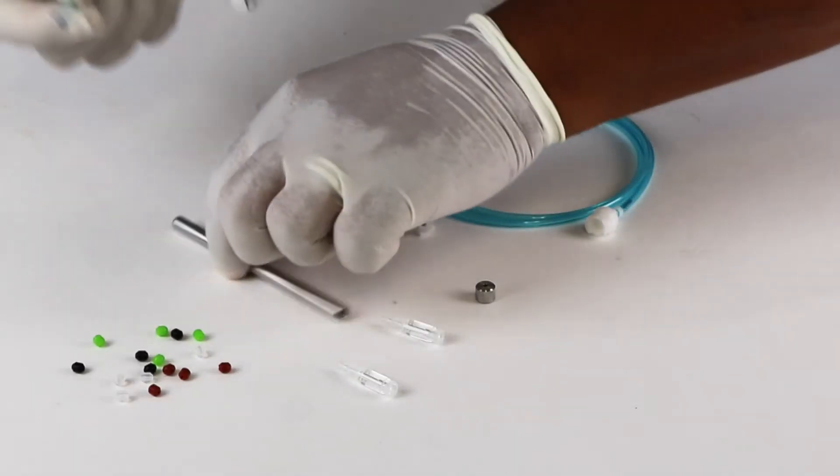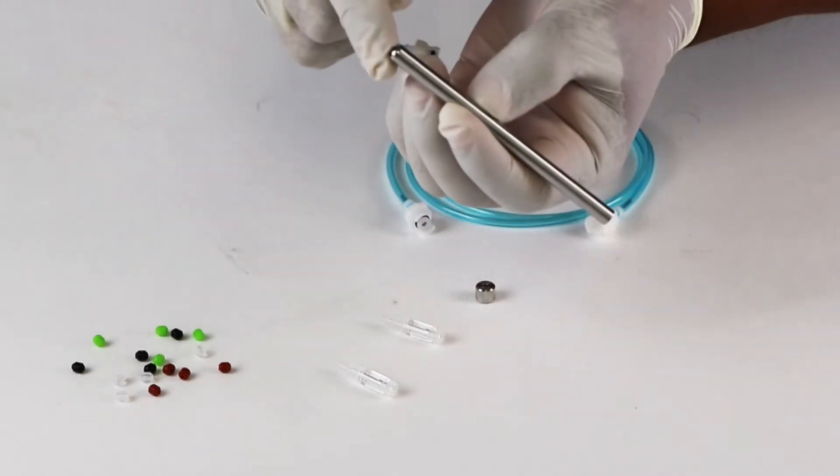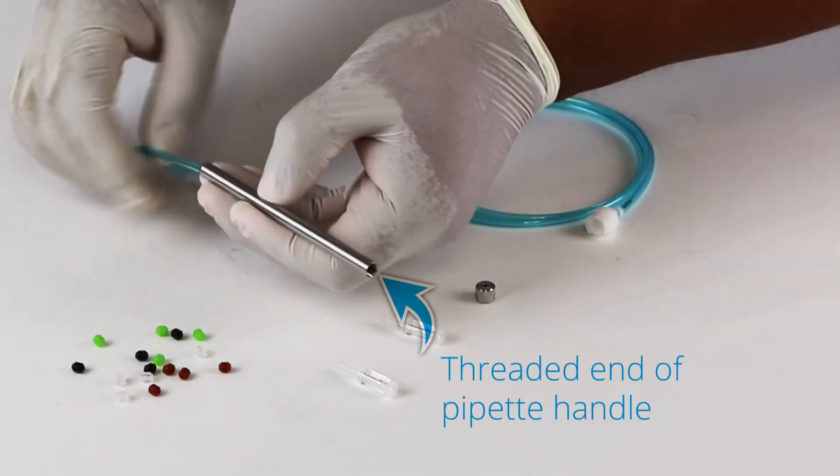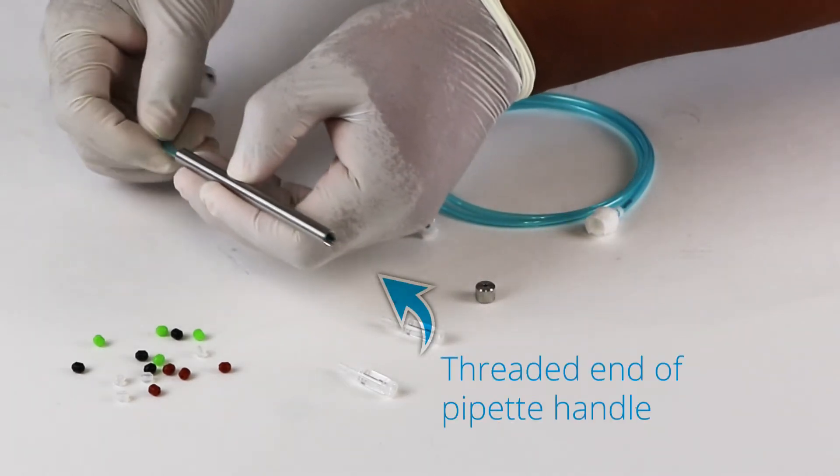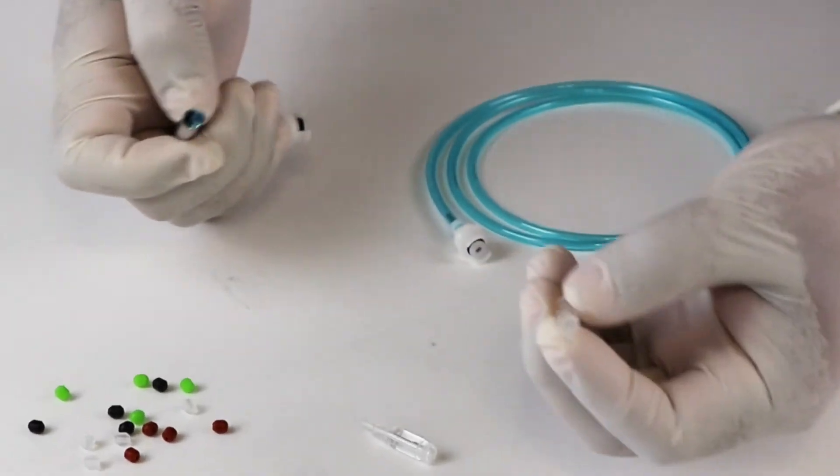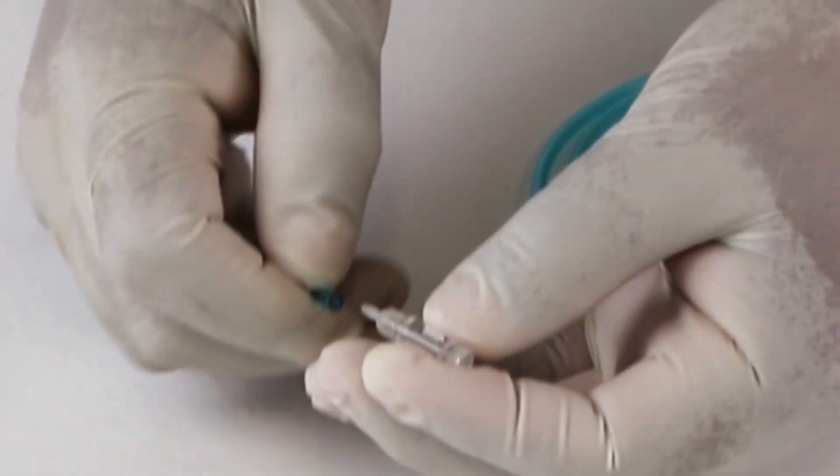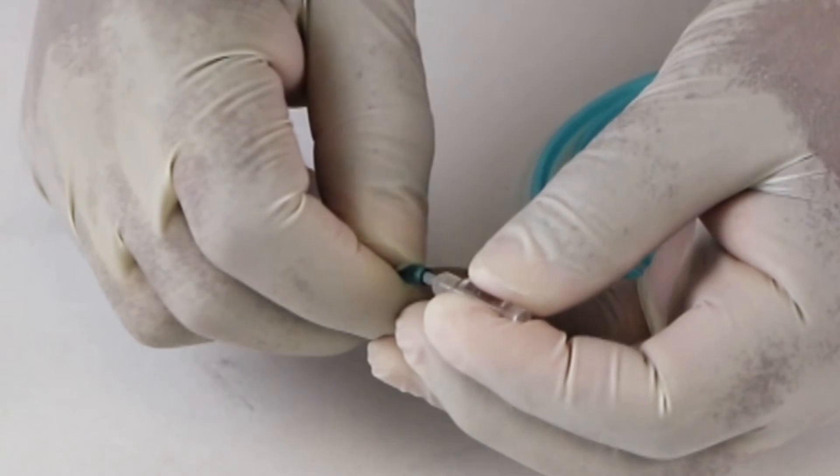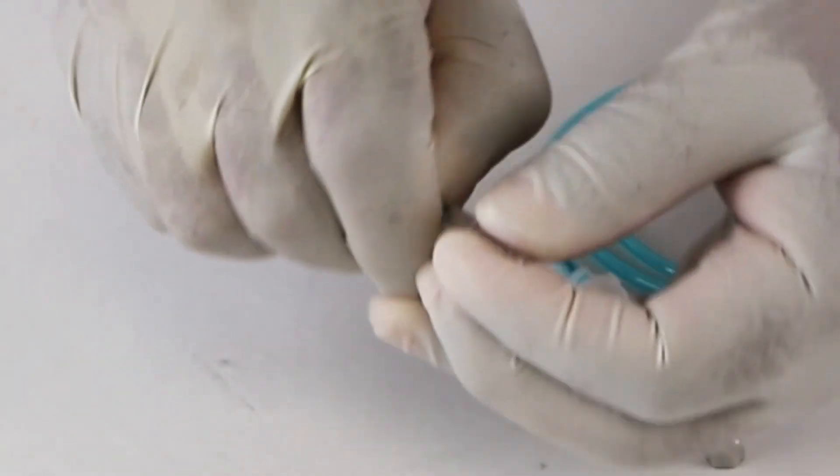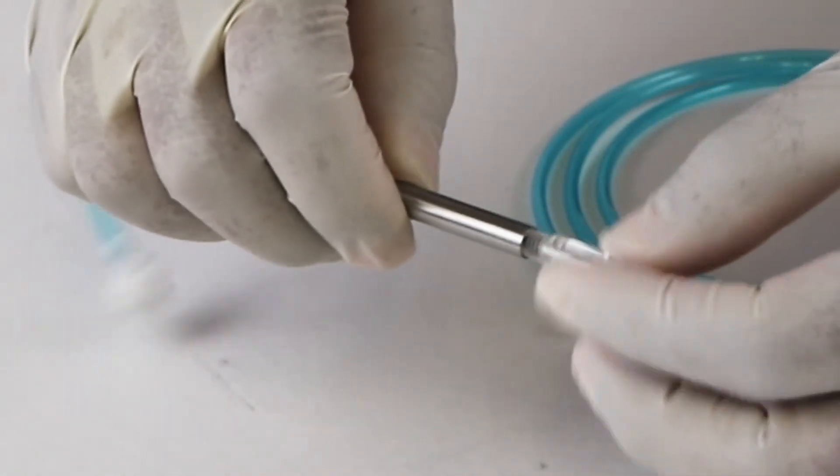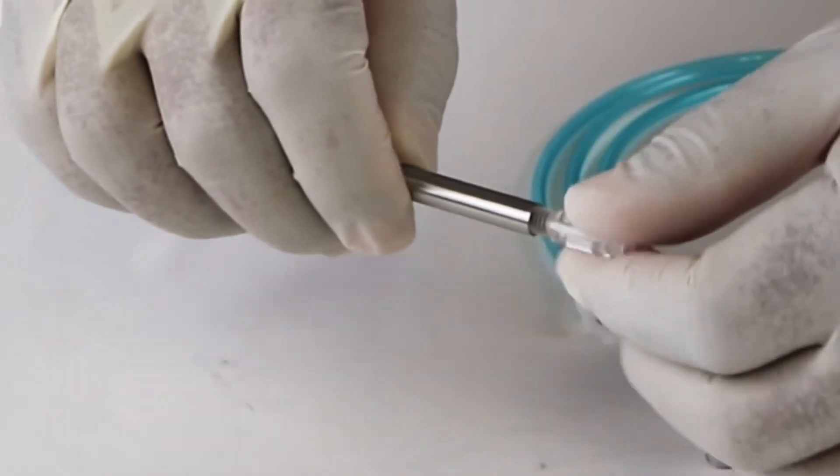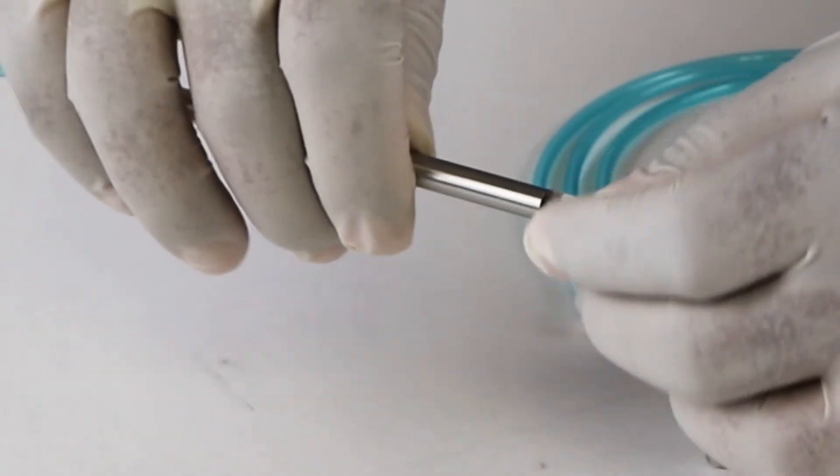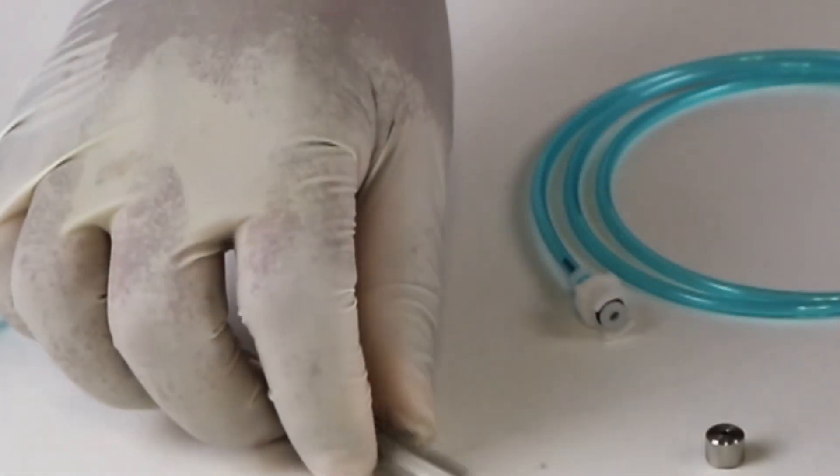Next, connect the capillary holder tubing assembly. Slide the bare end of the adapter tubing assembly through the pipette handle. Connect it to the barb of the pipette holder body. Be careful so the barb does not break when attaching or removing the tubing. Slide the pipette holder over the barb and carefully screw it onto the body of the pipette holder. Be careful not to cross thread it.